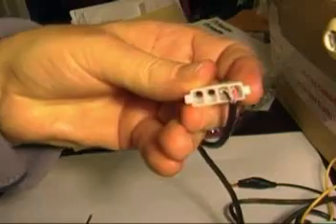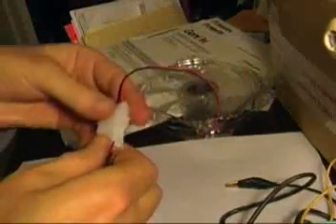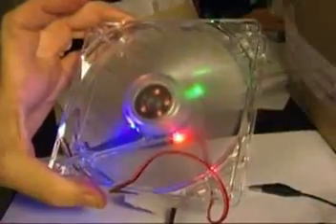Once those two are in there, we're pretty much ready to try it out. I plug it in here and reach over and plug it into the wall and — yes, success! So that's the first part of our stir plate. We'll be mounting magnets and showing this plate later.